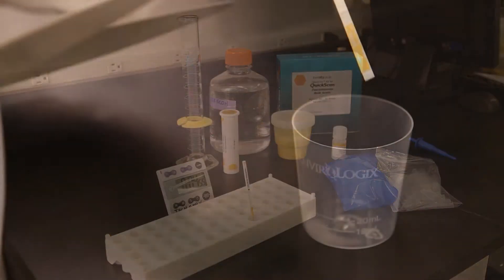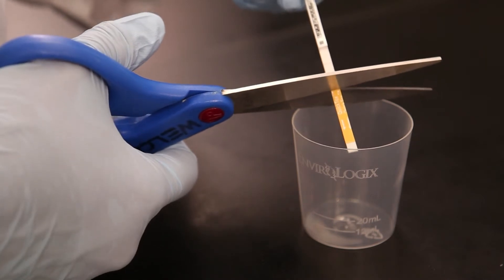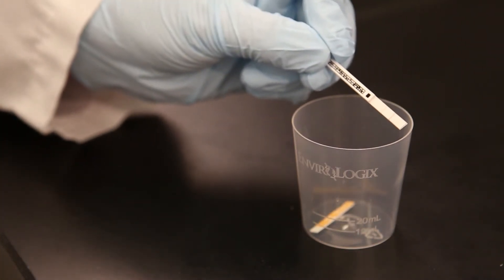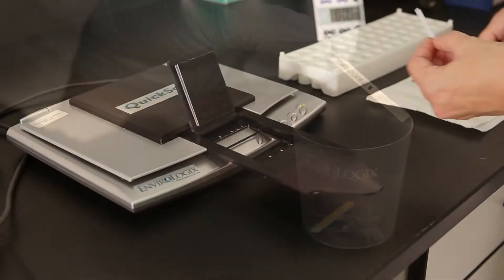At the end of 5 minutes, immediately cut off and discard the arrow tape section of the strip and insert into the QuickScan system for quantification.